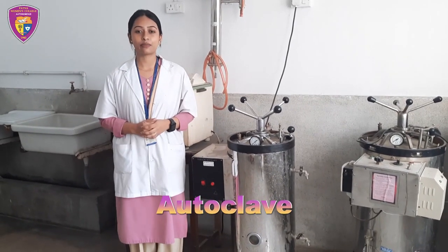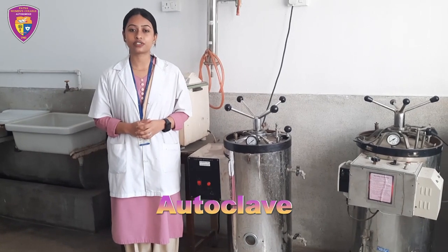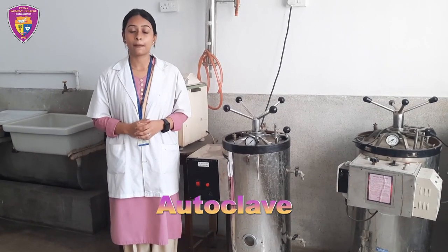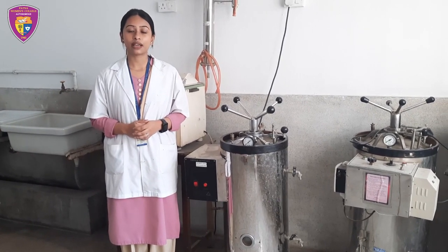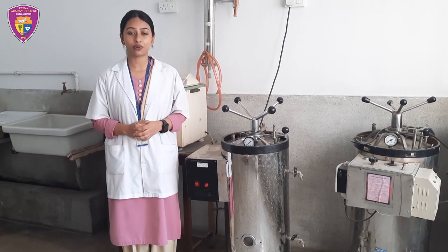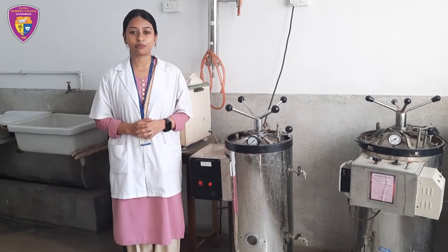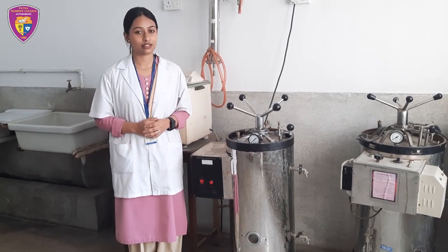This is an autoclave. An autoclave is a machine that provides a physical method of sterilization by killing bacteria, viruses and endospores present in the material put inside the vessel.